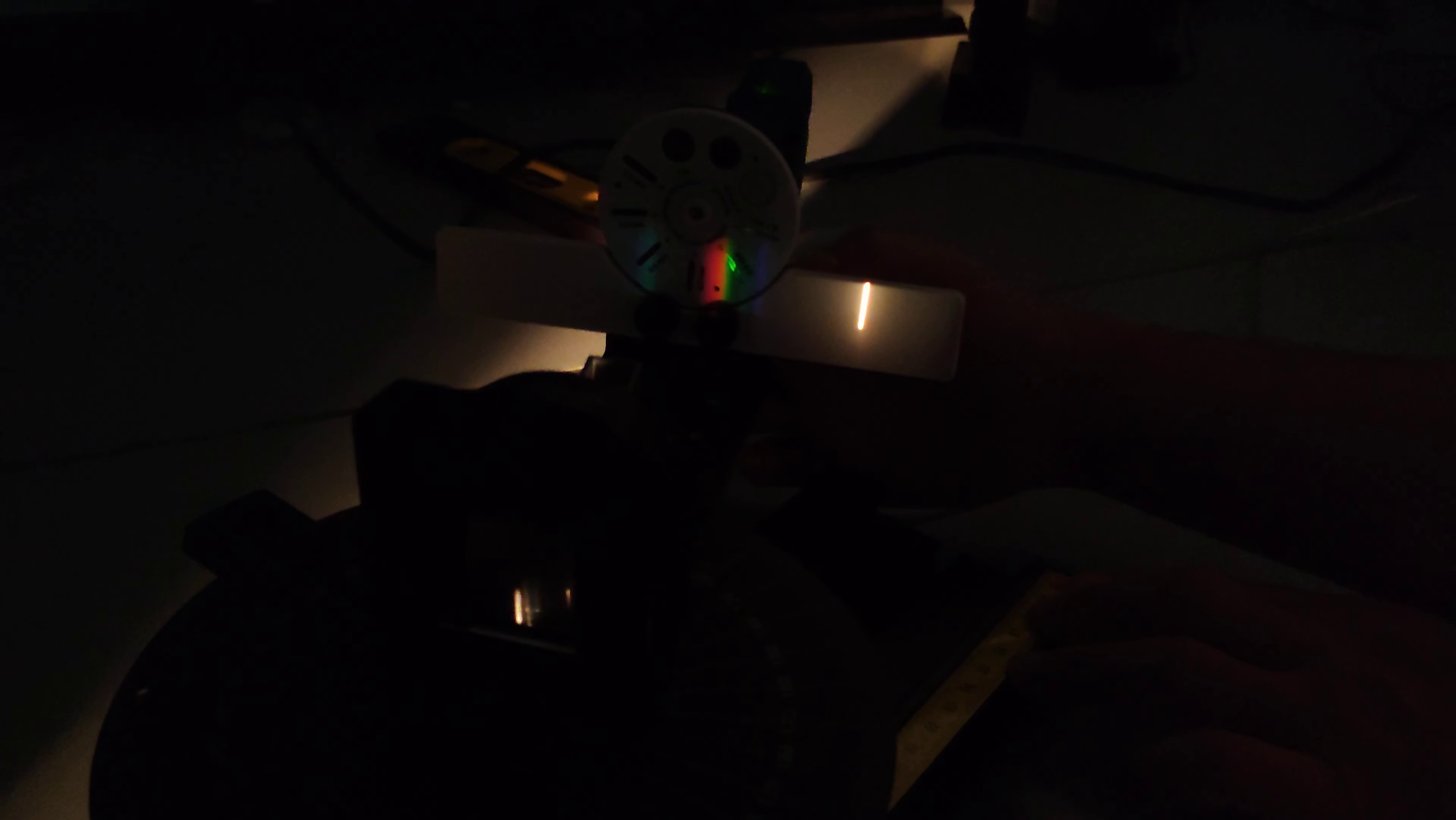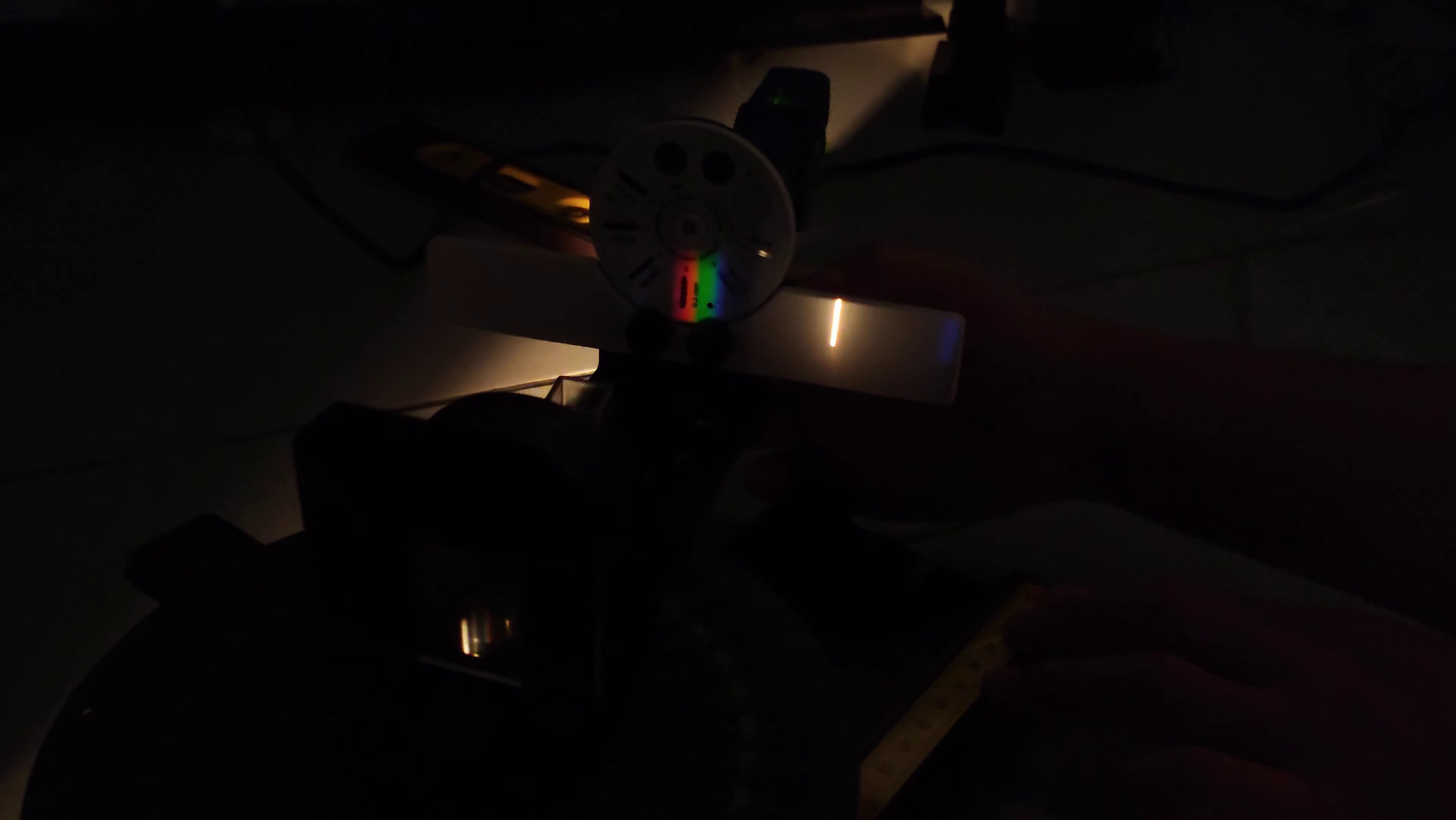Now I'm turning on the program, and then I press the record. Then I start moving slowly.